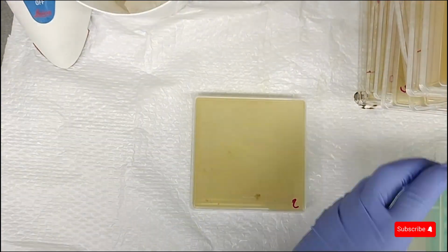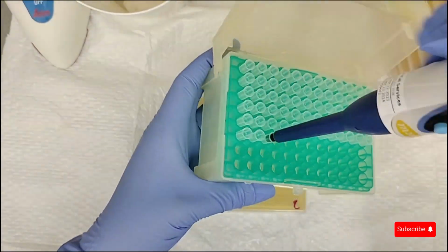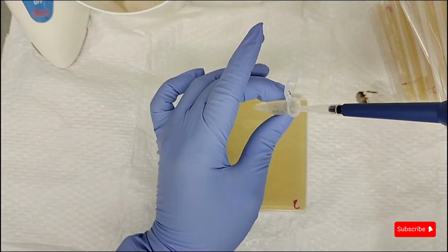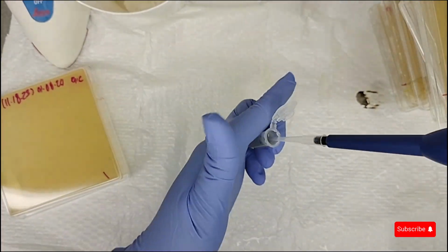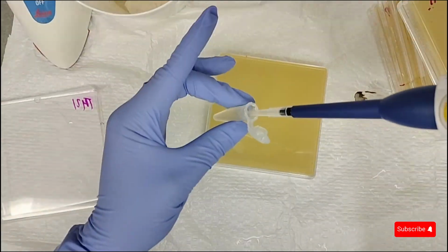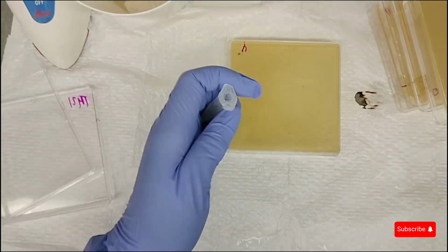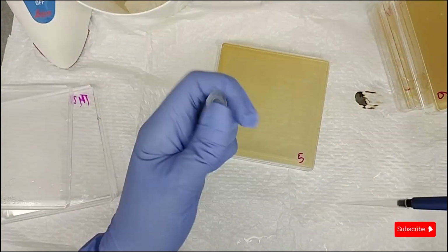And labeling is a crucial practice in the lab. I label with my initials, the date, the project code, and the pathogen ID. Since the fungal sample passed the quality control test, I'll take 100 microliters, or 0.1 ml, aseptically from the vial and pipette it into the center of the agar plate. I'll repeat this process for however many plates I'll be using in the next phase. So I think I have about 8.